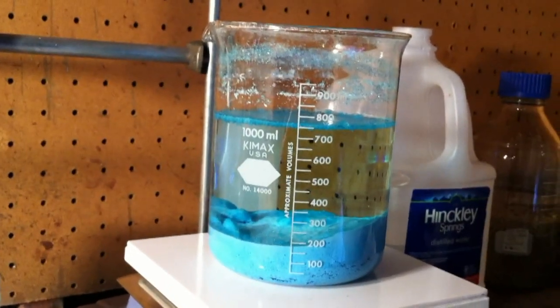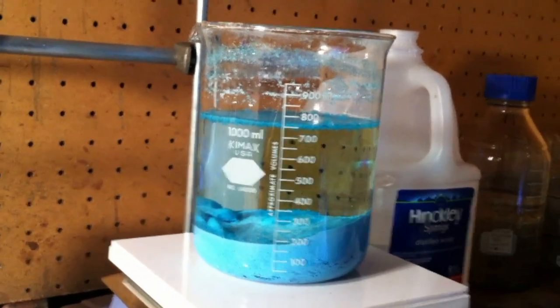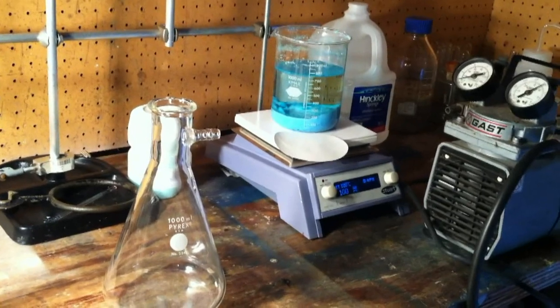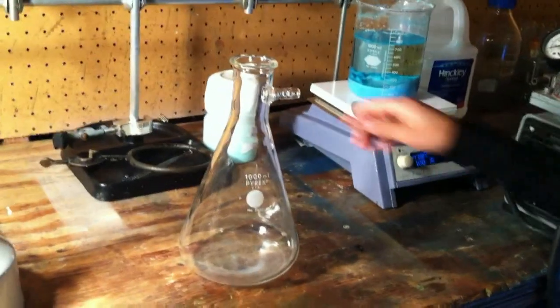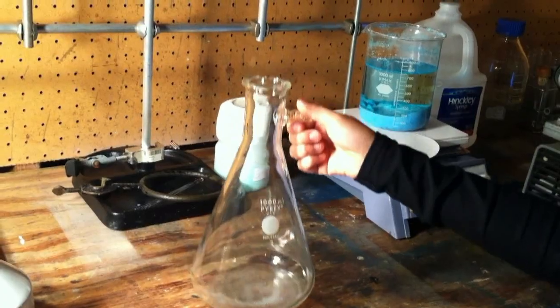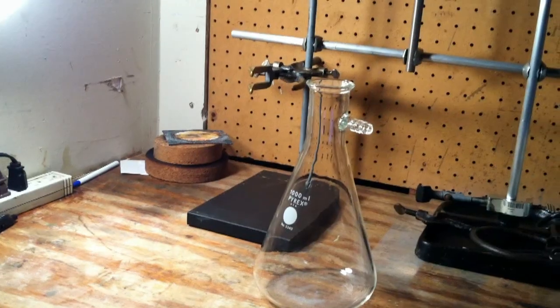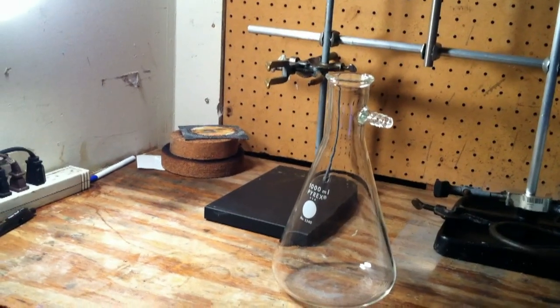Now set up for vacuum filtration. To do a vacuum filtration, you will need a vacuum flask. Here it is. We will now attach the vacuum flask to the clamp.